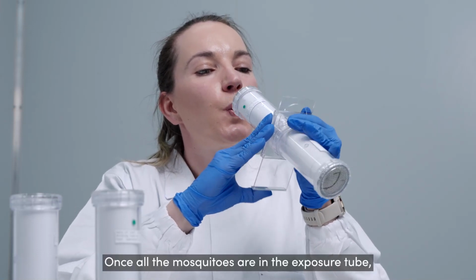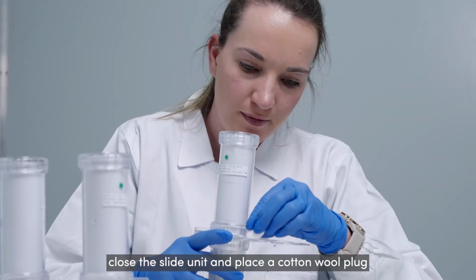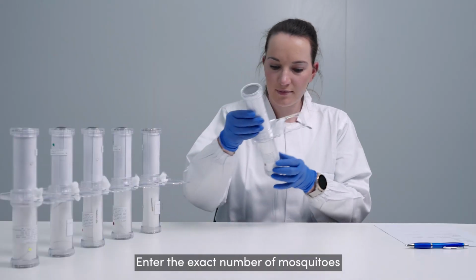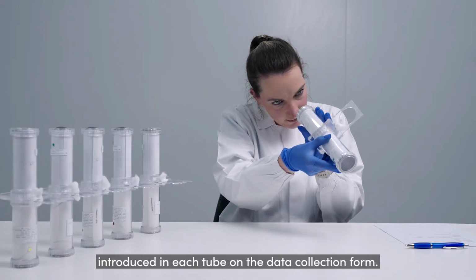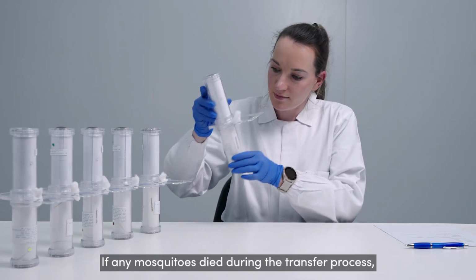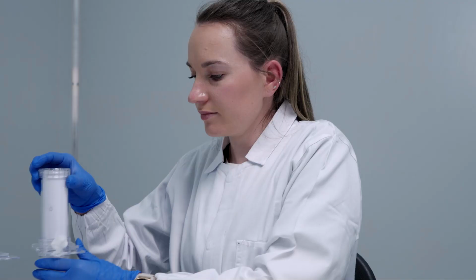Once all the mosquitoes are in the exposure tubes, close the slide unit and place a cotton wool plug into the hole to lock the slide. Enter the exact number of mosquitoes introduced in each tube on the data collection form. If any mosquitoes died during the transfer process, note the number in the data collection form.